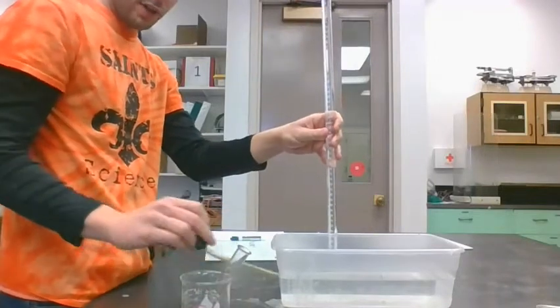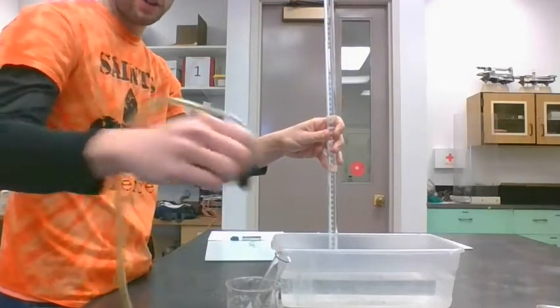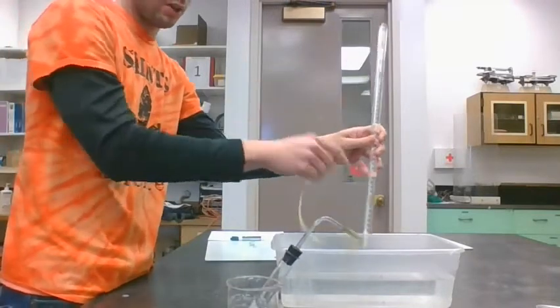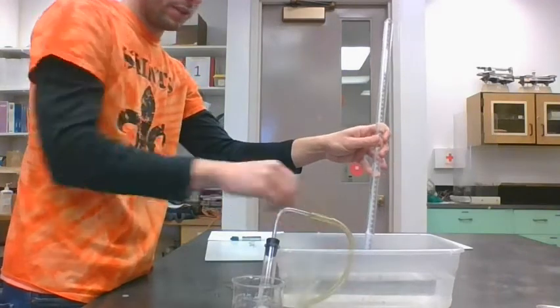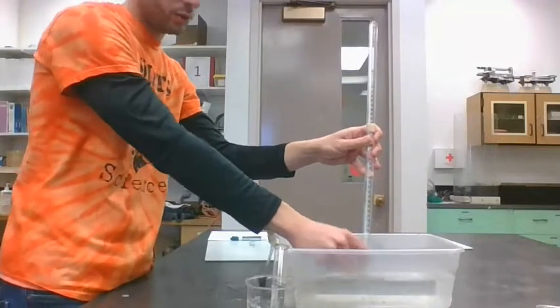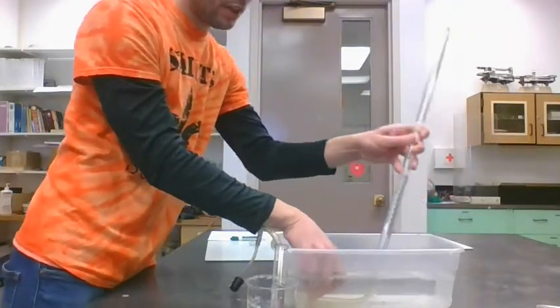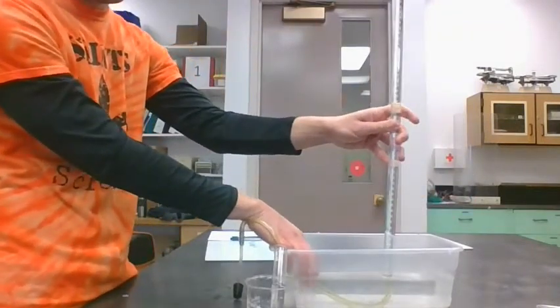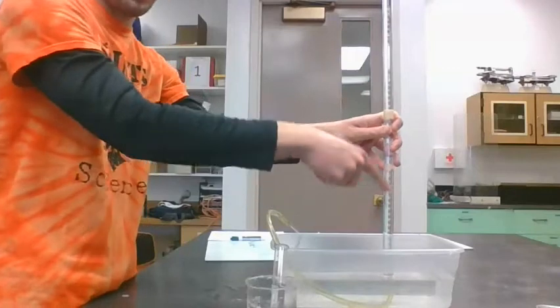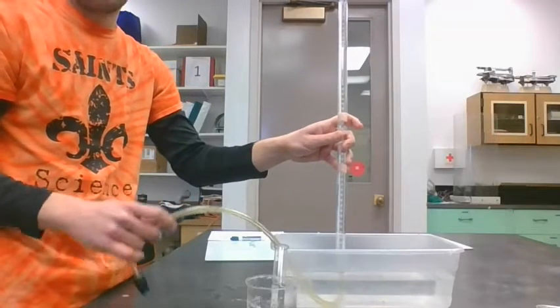So to collect in our test tube, after we do our reaction, we're going to put this stopper on top of the test tube. The stopper is connected to this hose. This hose is going to go inside the water. The end of this hose is going to go under the water. I'm going to tilt the eudiometer so that the end of that hose is spitting the gas into the eudiometer. It'll travel through the hose up here, kick the water out, and we'll be able to read how much gas is formed.